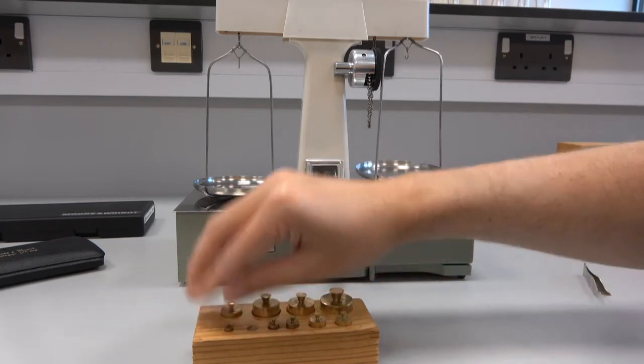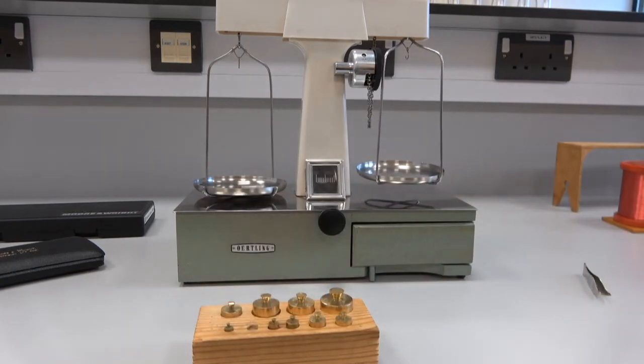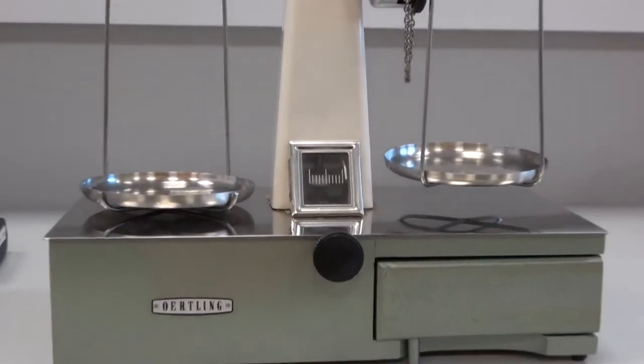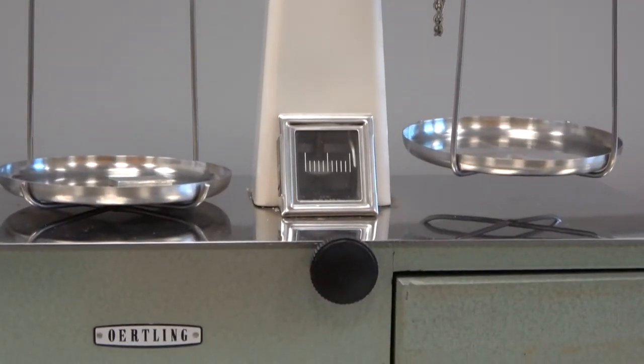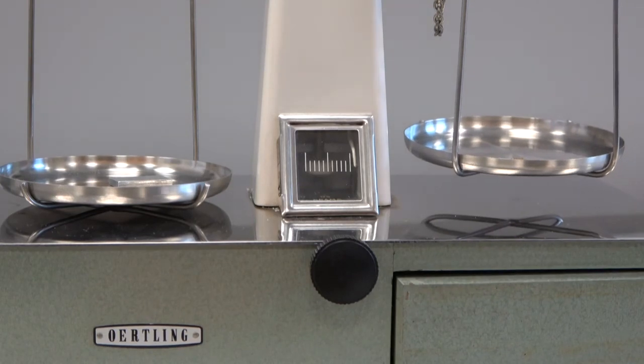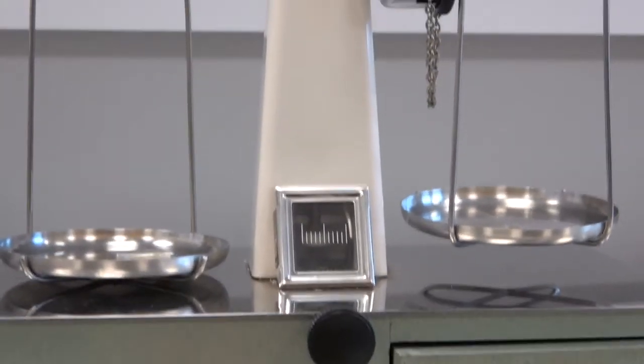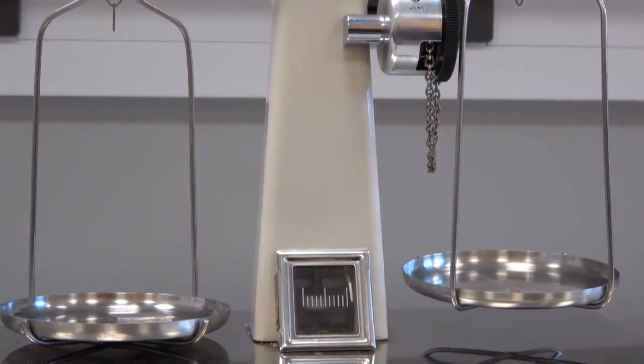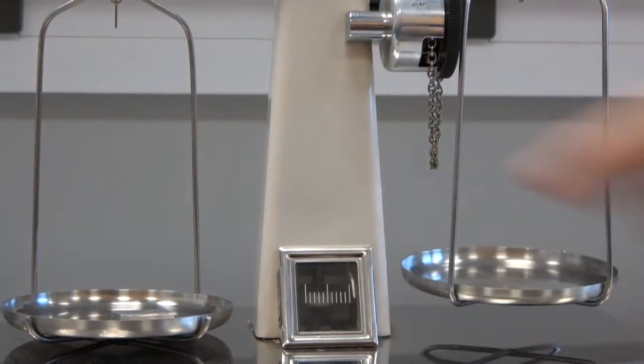So I'm going to go and just grab the one gram off. And what I'm going to do, I'm going to zoom in just a bit on the scale here. So I'm going to click the chain. So you'll see my hand just on this thing. So I'm going to click it until this scale balances somewhere.